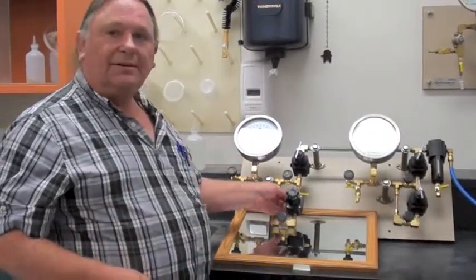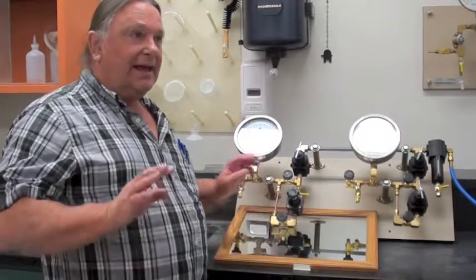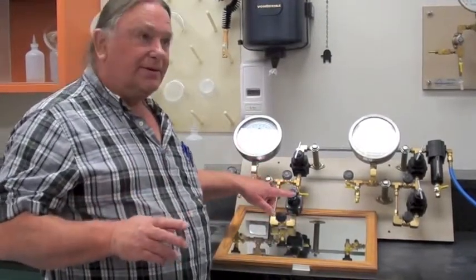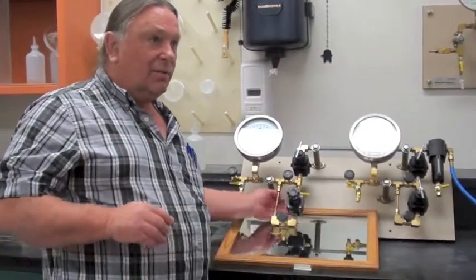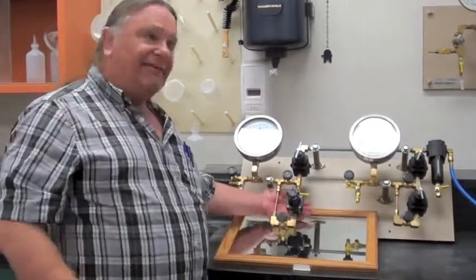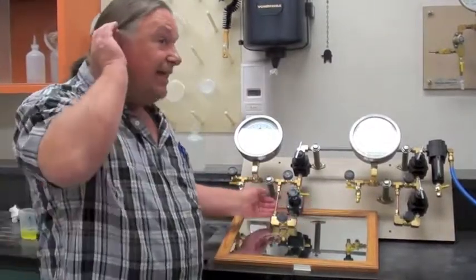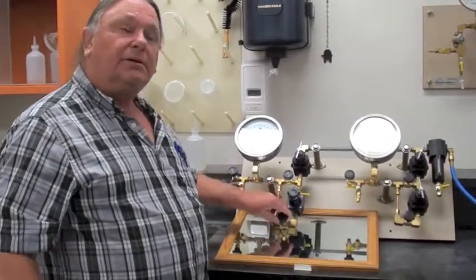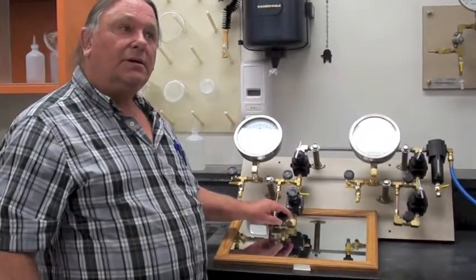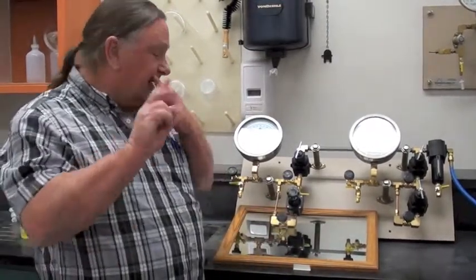So there are two ways you can get the Nullmatic not to work properly. It always leaks. It leaks when it's at zero, it leaks when it's at pressure, it leaks a lot. When it leaks normally, you don't hear it and you can't feel it on your skin. When it leaks wrong, you feel it on your skin and you hear it. And you can also see the drop in pressure. So once you hear that regulator leaking, something is wrong. Most likely one of two things.